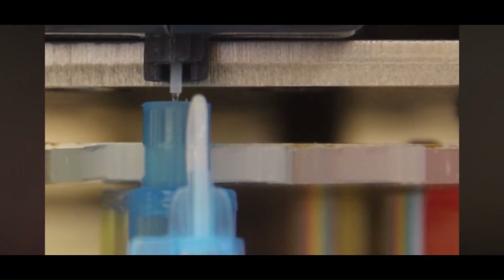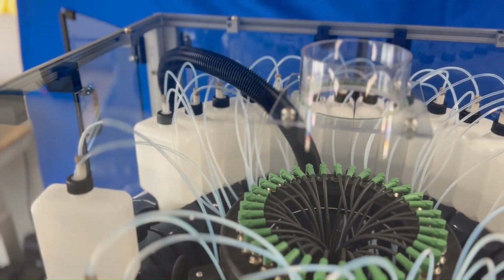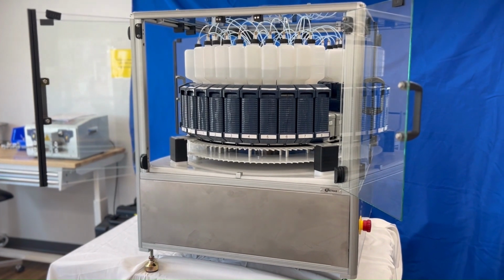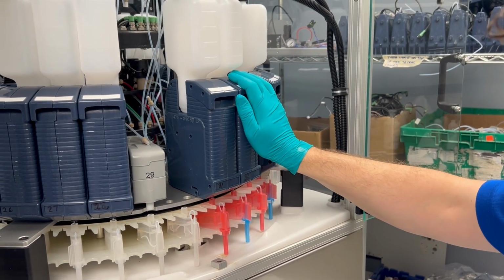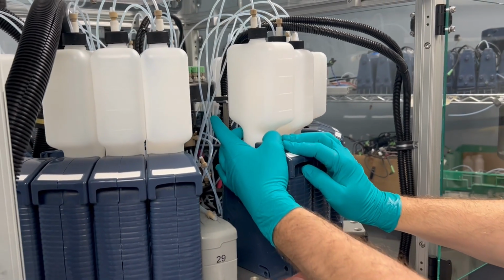With the software programming now complete, we'll head down to the lab to cover the different injection station configurations and the assignments for this particular demo. We're now going to be looking at the internals. So we're using 31 for alanine and 32 for cysteine. So these have the bottle supply on top of them.